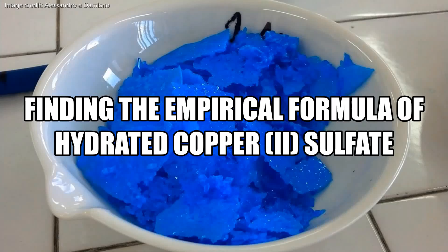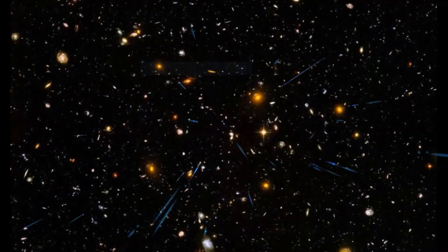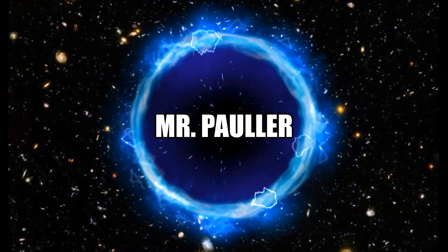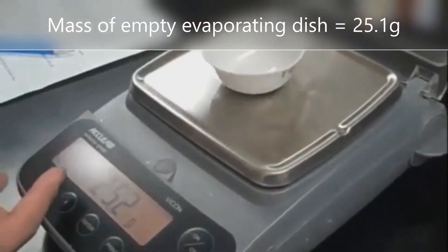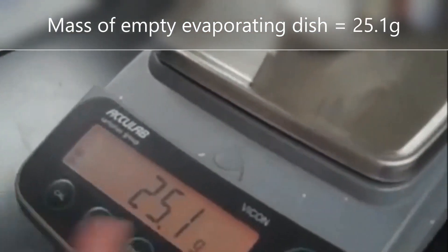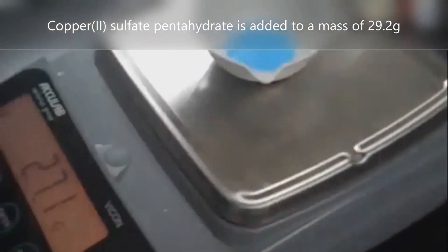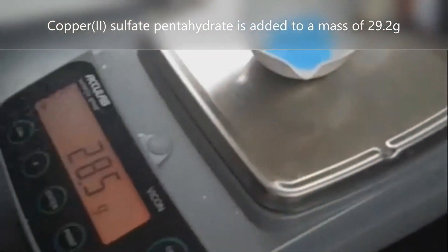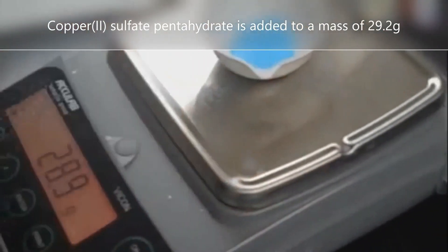This video discusses how to analyze data from an experiment performed to find the empirical formula of copper sulfate. The first step in the experiment was finding the mass of an empty evaporating dish, which measured 25.1 grams. Approximately 4 grams of hydrated copper sulfate, a blue crystalline powder, was added to an evaporating dish until the mass measured 29.2 grams.